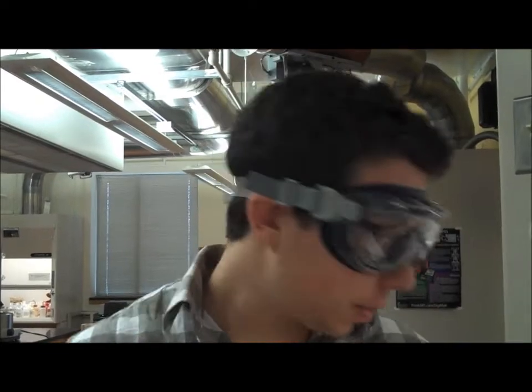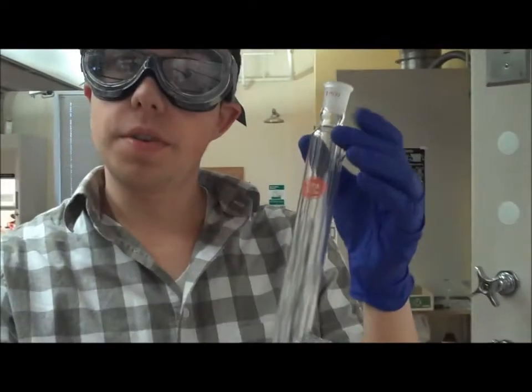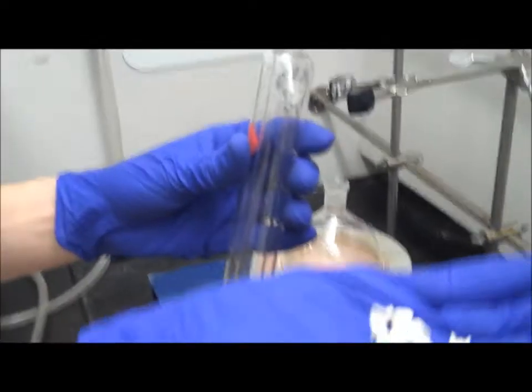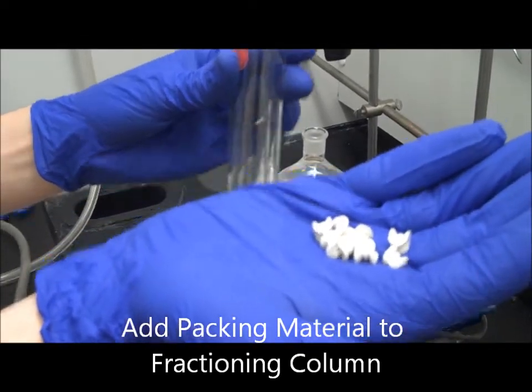In fractional distillation, packing material is added to the fractioning column to ensure a more pure distillate. Here, we have a fractional column without any packing material. For our demonstration, we will be using ceramic saddles and adding them to the fractioning column.